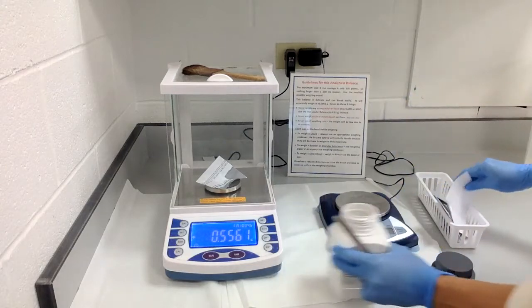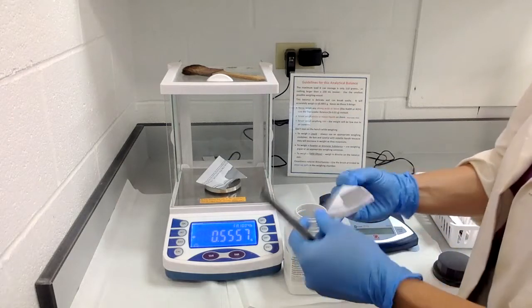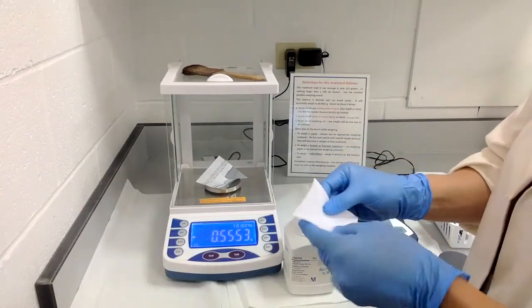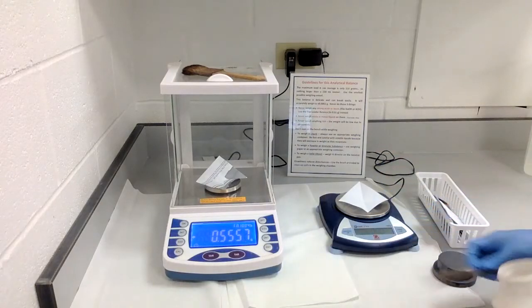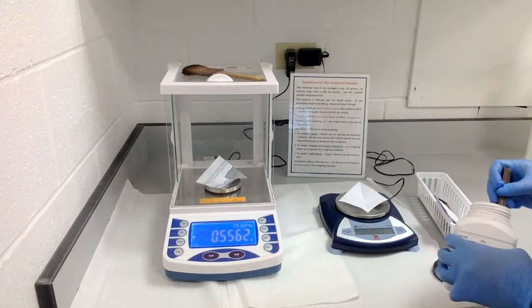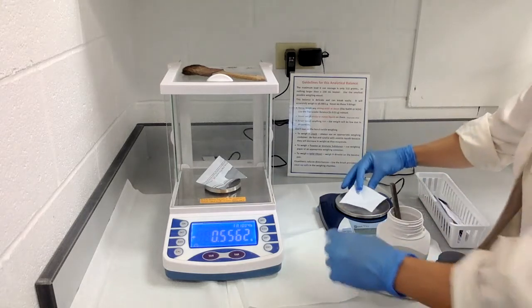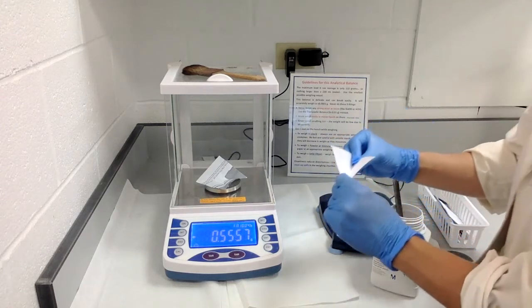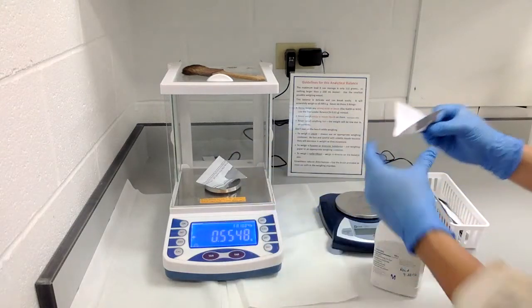For the top loading balance, make sure it's on and zero it. Create your weigh paper by folding it in half a couple of times to get a nice little weigh paper. Place it on top of the stage and zero it again. Then you can weigh out your target — for example, 0.22 grams on this scale would be good for a 0.2 gram target. When ready to take your sample, fold the paper so all the compound is within the creases, which helps you carry it from the scale to wherever you're going.